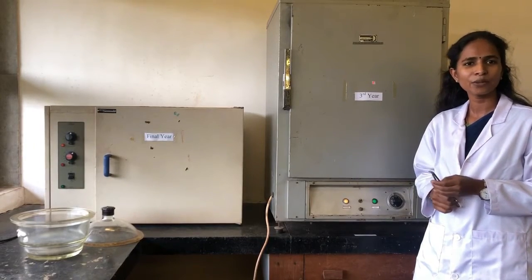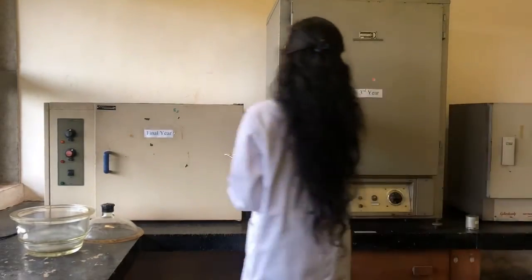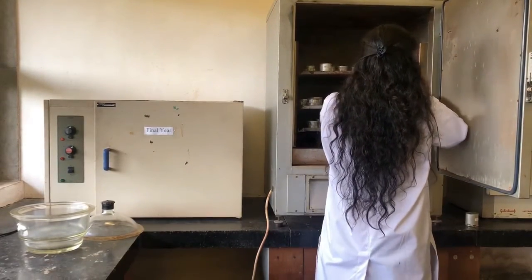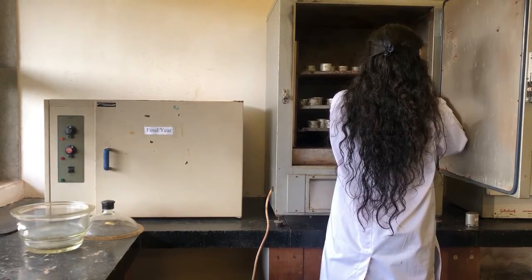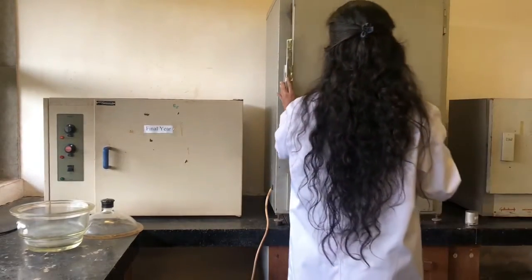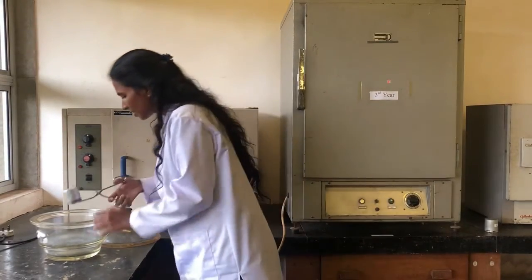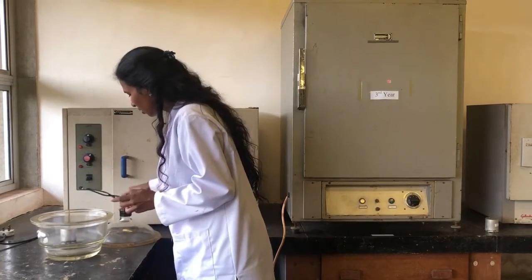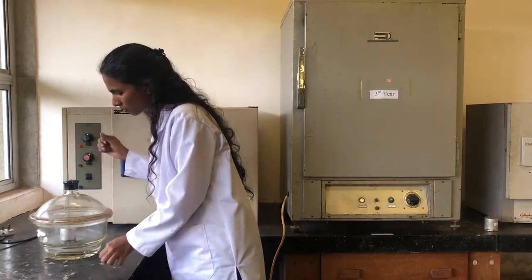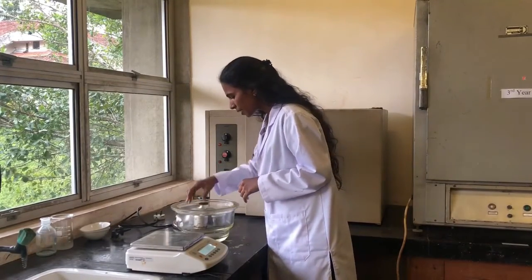We set the temperature at 105 degrees Celsius. Now we take the samples outside the oven as they are ready. After taking the samples from the oven, we keep them in the desiccator for cooling purposes. Now the samples are adequately cooled, so we remove them from the desiccator.